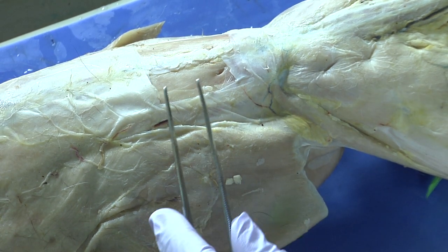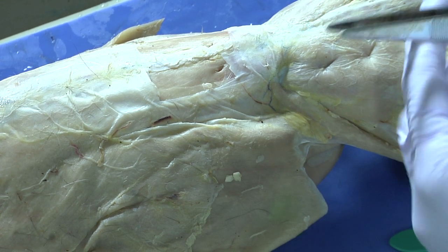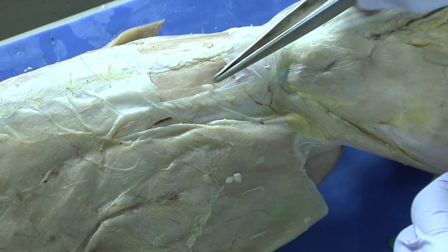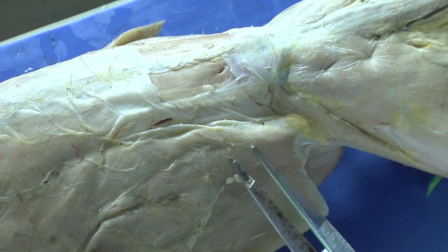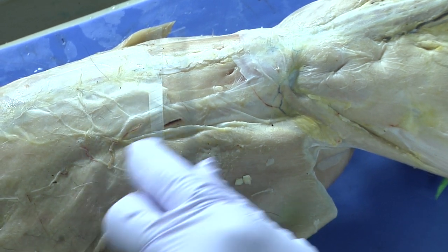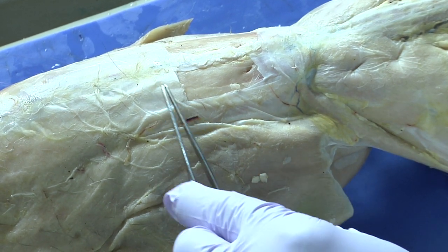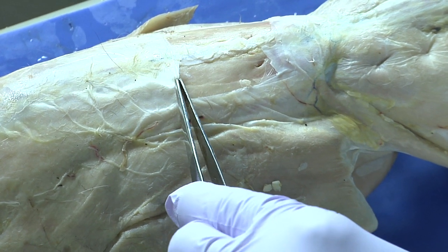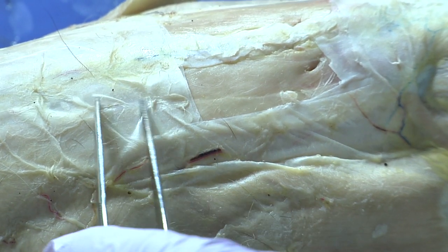In order to see them, you actually need to remove a dense irregular connective tissue. It's already been removed here so that you can see the muscles. But in terms of how to get to this connective tissue, the loose connective tissue that you removed at the very beginning will help you get to this. It'll look white like it looks here, but when you get down to this level, you will not be able to just use your forceps to clear this off — it's just too dense.